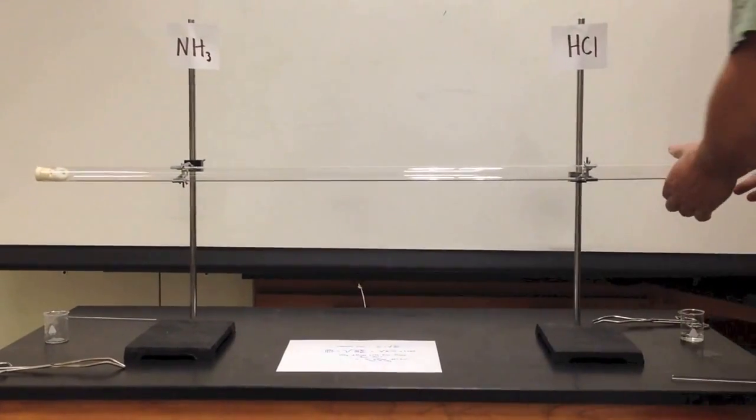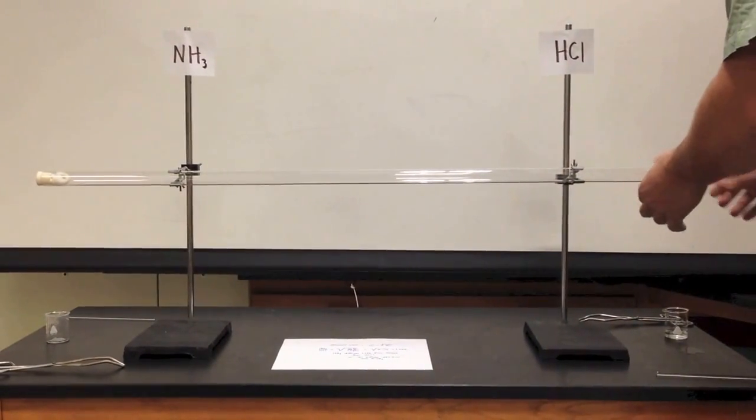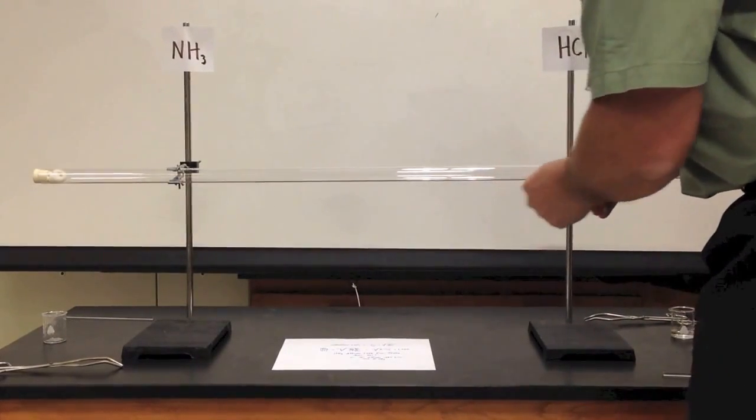Just make sure my tops are on. We're going to have to wait a few minutes and come back, and I'll show you that line.